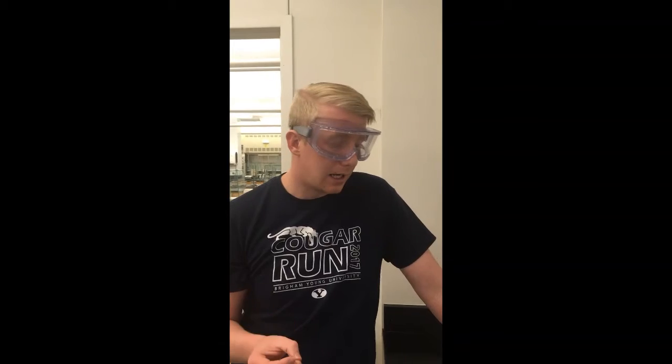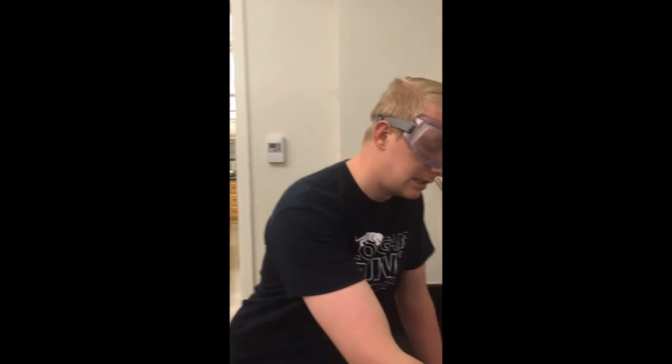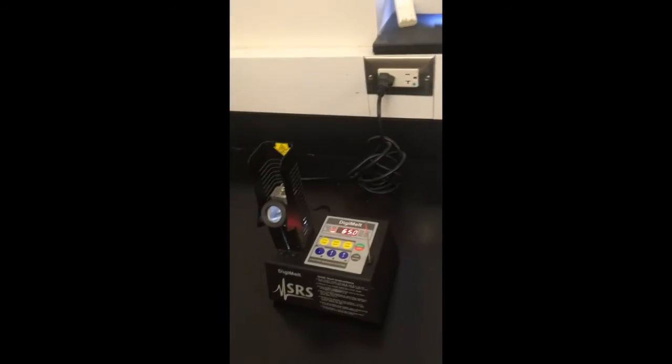And like I mentioned, the amount of sample that you pack in the melting point tube can also impact the temperature at which the compound melts. The third factor, which I'll talk about in a moment, is going to be the ramp rate on the instrument, or how quickly we are increasing the temperature in the melting point apparatus.